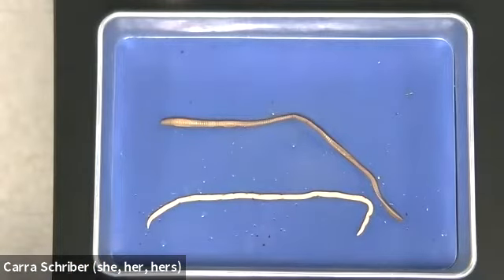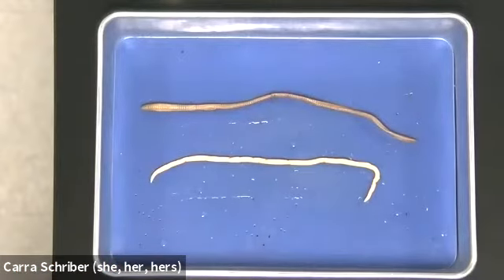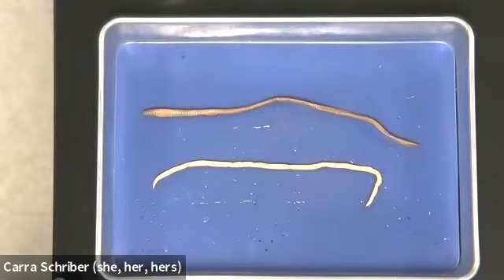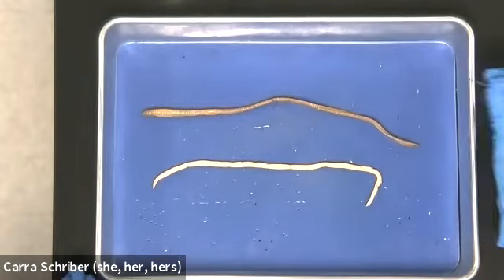But the main difference is the coelom status. I thought that if we did a dissection of each, a roundworm, which is a pseudocoelomate, and a segmented worm, which is a true coelomate, we could take a look at the complexity of the internal components and do a little comparison.